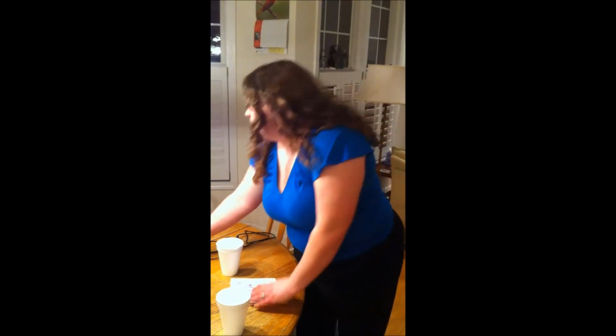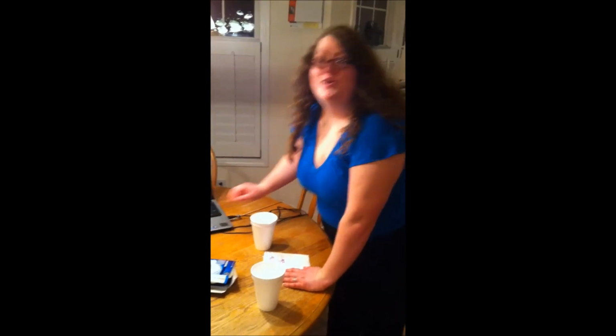Okay, good. So now I'm going to have you guys write down your observations, and in your post labs, you're going to compare this data to what you saw in your experiments from yesterday. Any questions? All right, thank you.